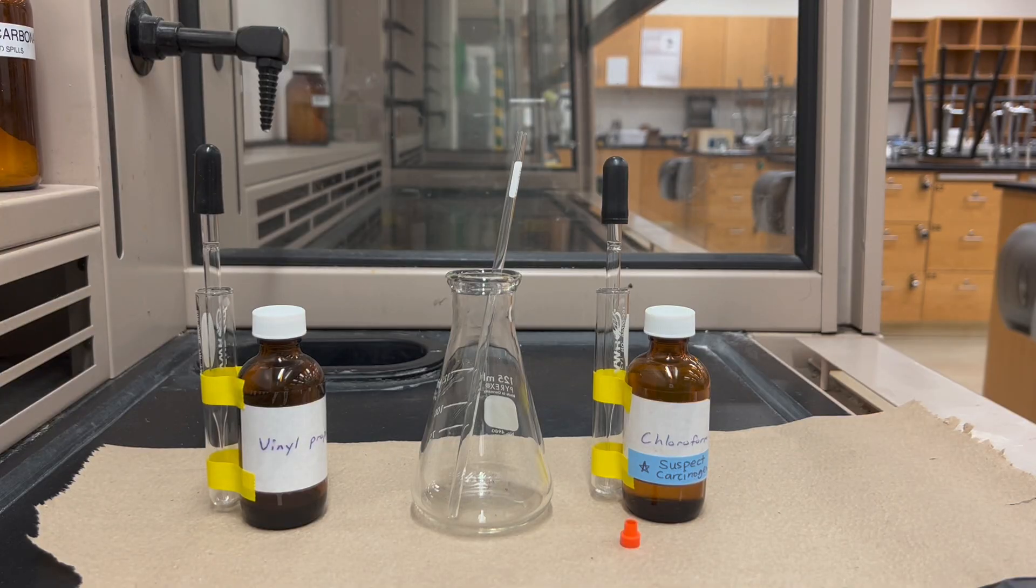I'll first put a clean NMR tube into an Erlenmeyer for support and next I'm going to add my deuterated solvent.